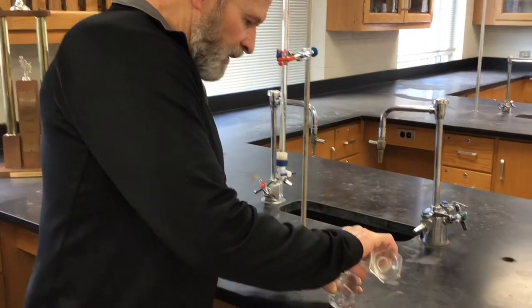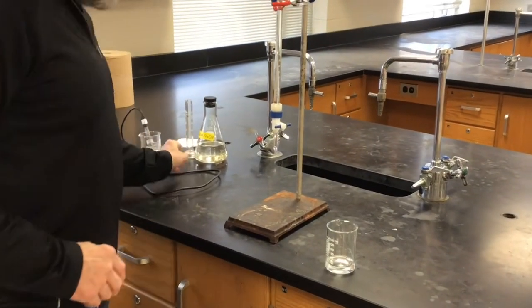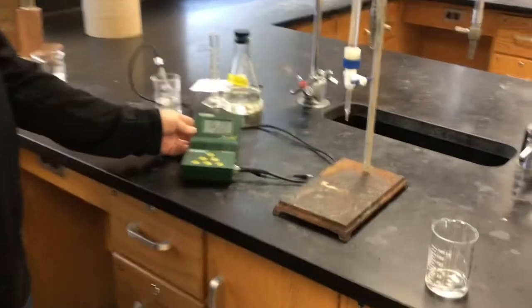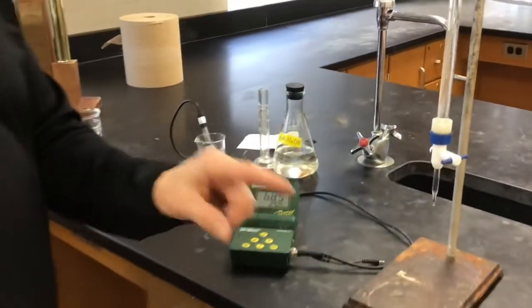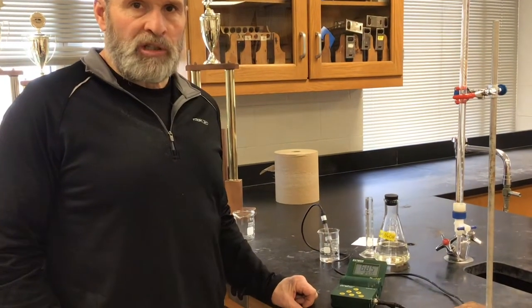I'm going to add it to a beaker. And instead of using an indicator like we did earlier in the year, we're using a pH meter this time around. The idea is that we're going to add some NaOH, record how much NaOH we've added, and let the pH meter tell us the pH of the solution. You'll end up with data that is volume of NaOH added versus the pH in the beaker. There's a data table in the lab write-up so you can record data as we create it.